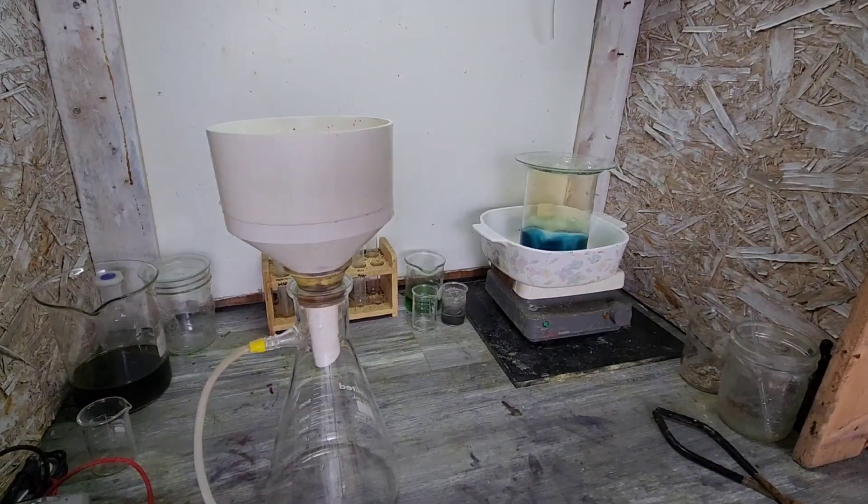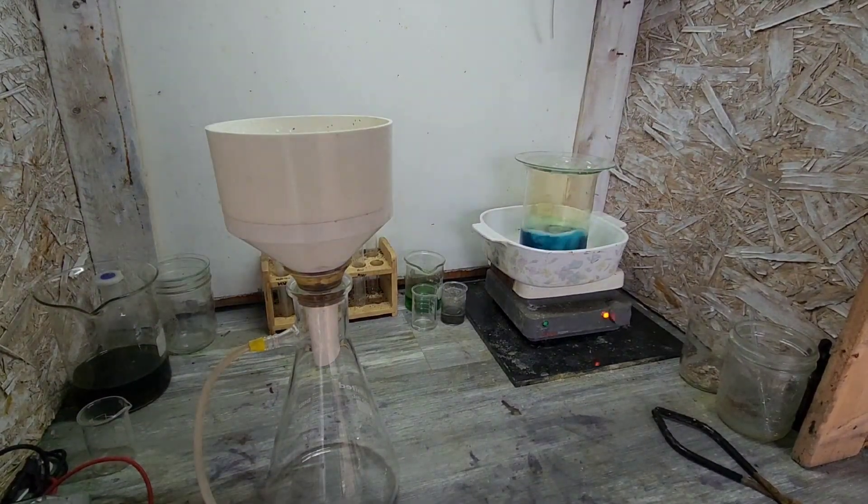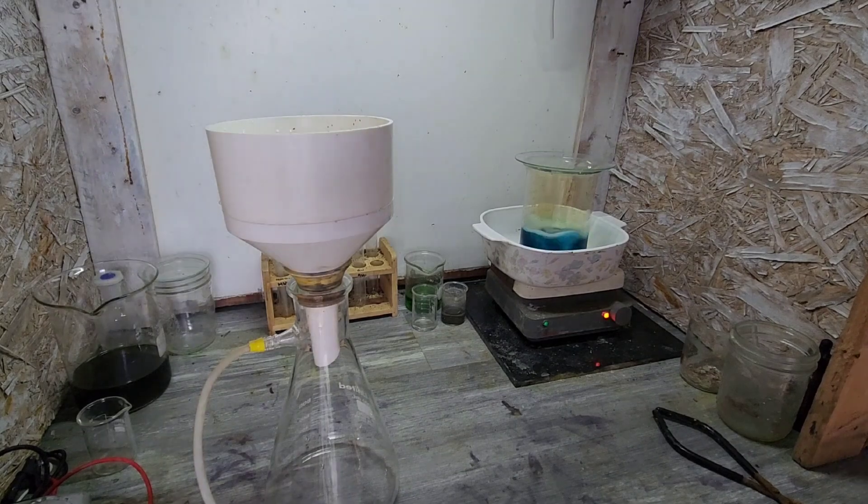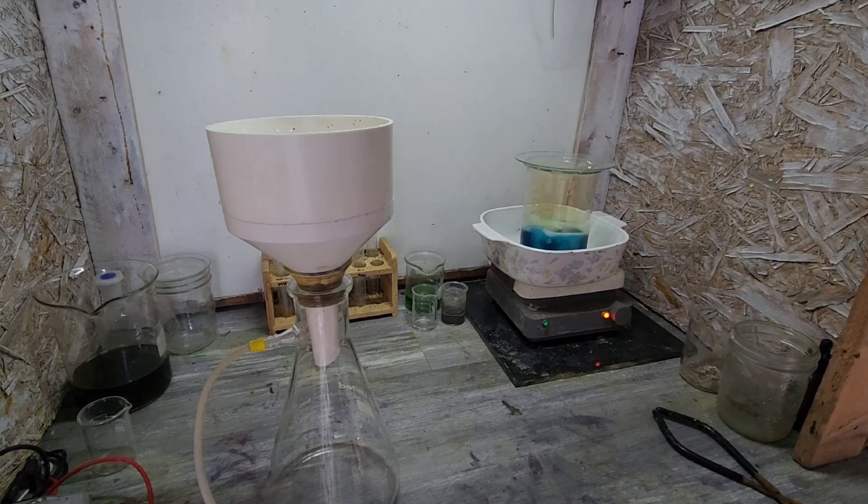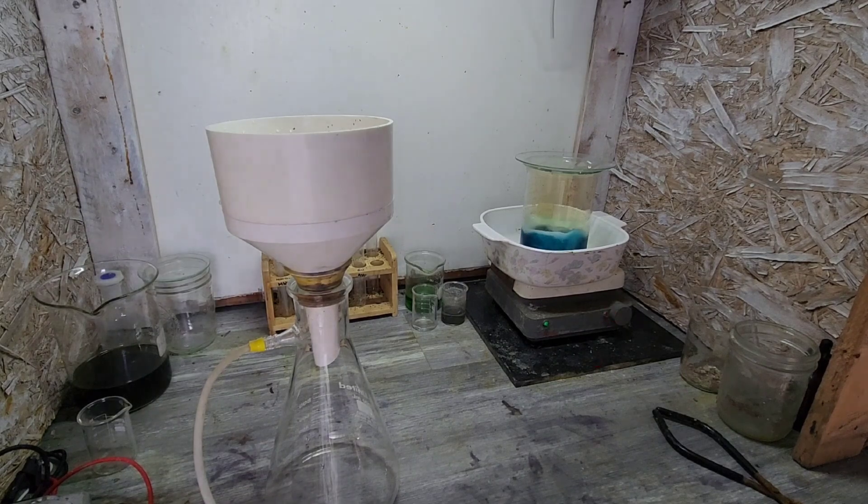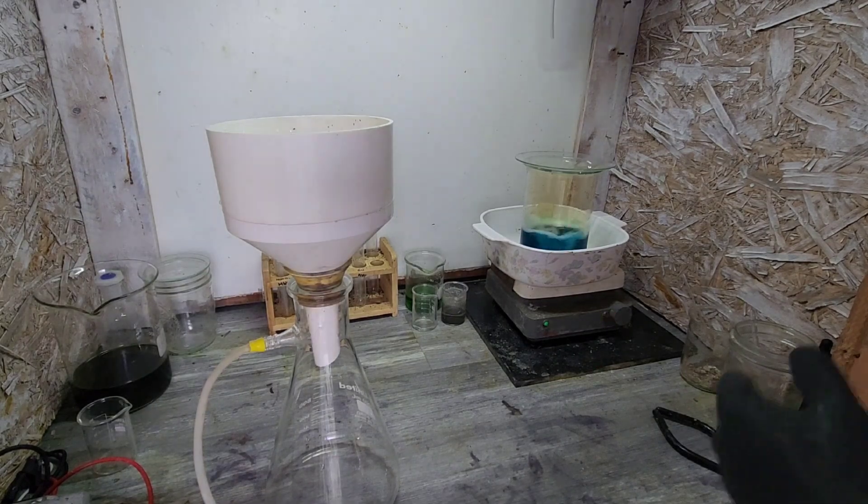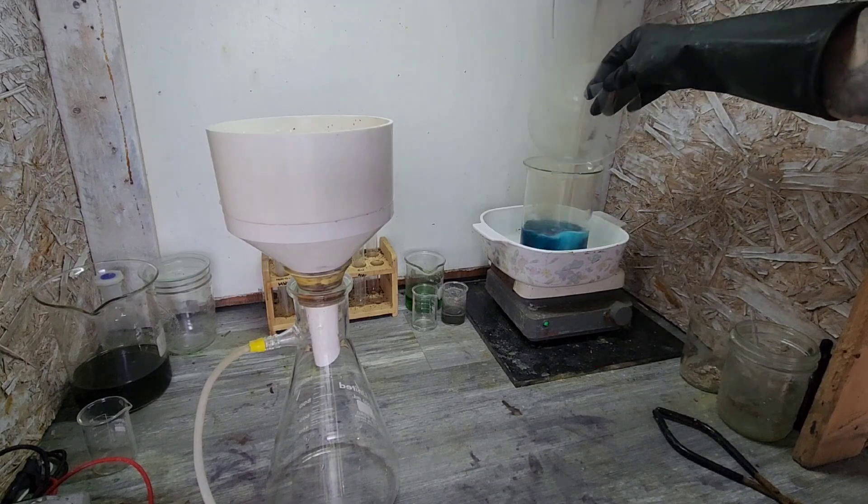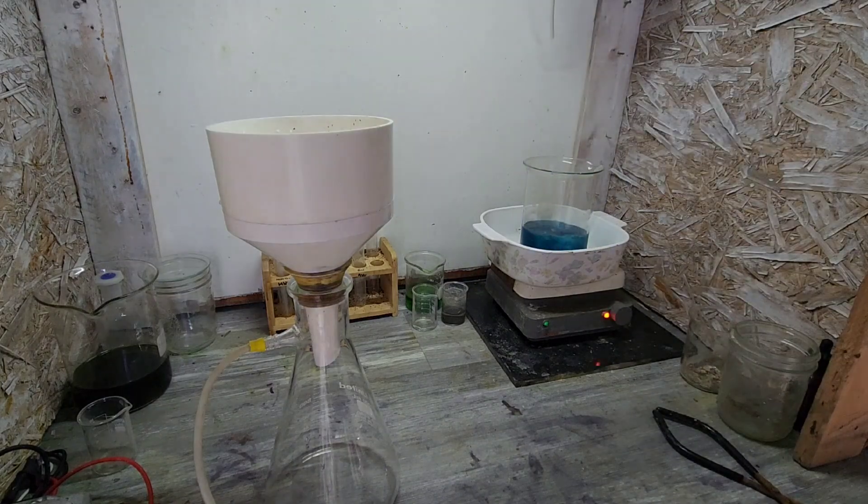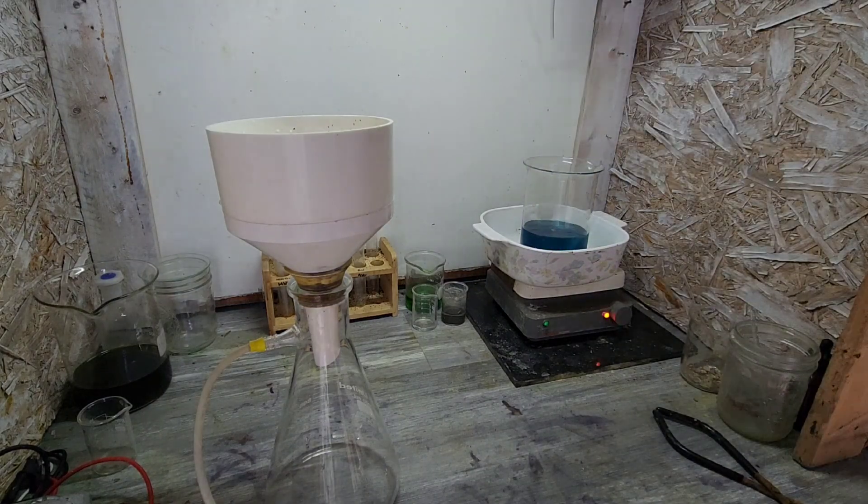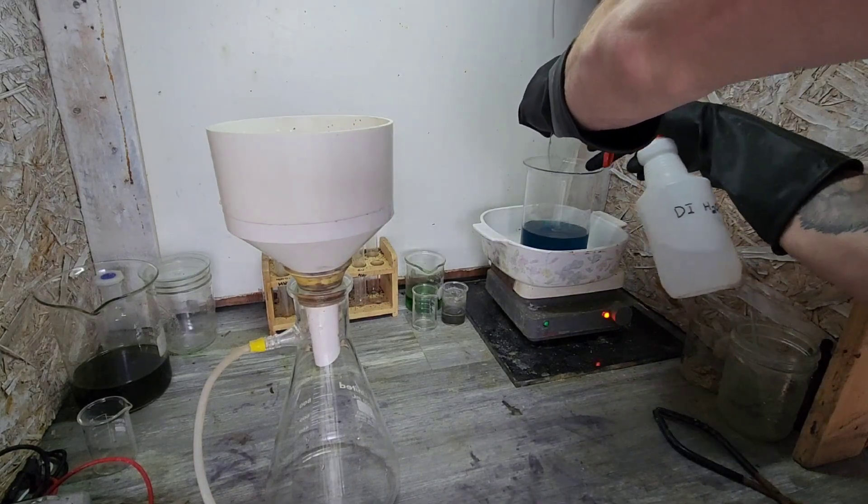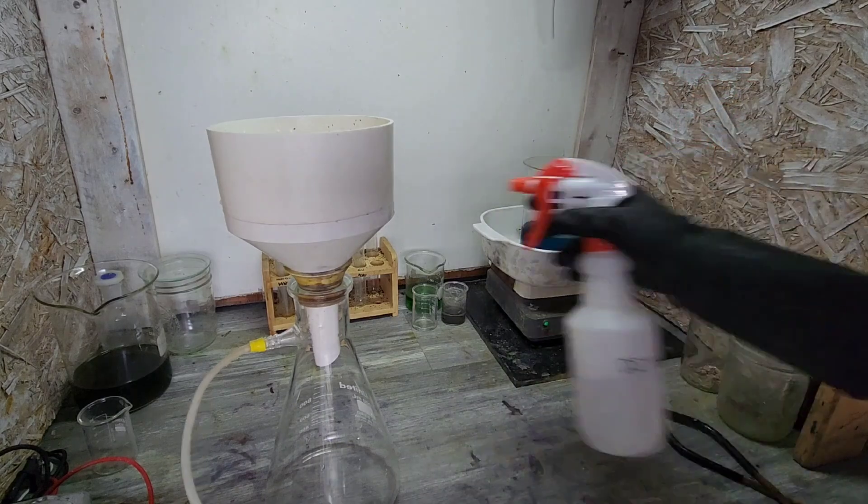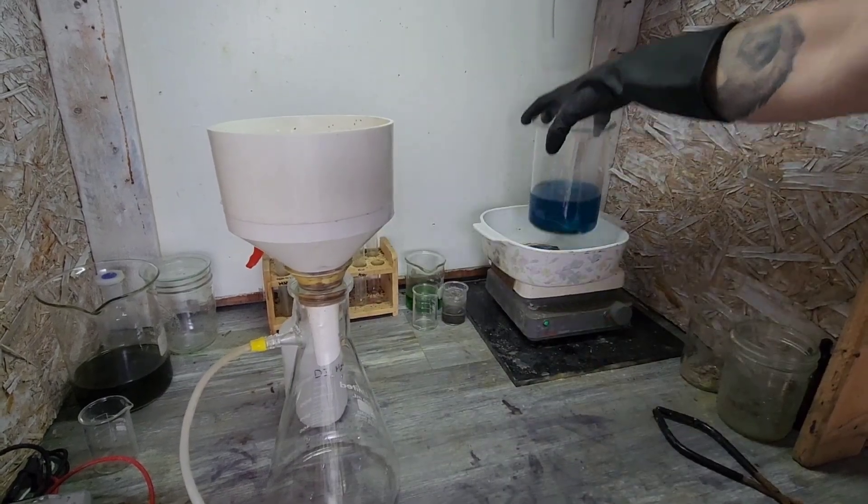All right, so we have a little bit of nitric fumes going on in there, but I don't think we have anything left. I think I just see the epoxy. So we might have overshot a little bit, especially we can see how it clears up right away. All right, let's take a peek here.